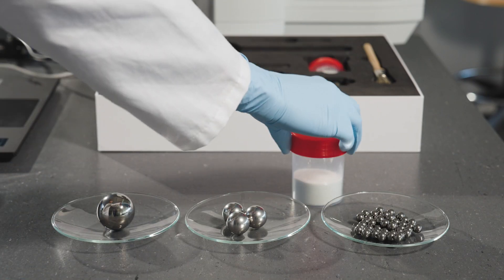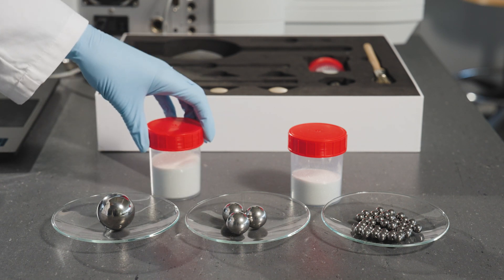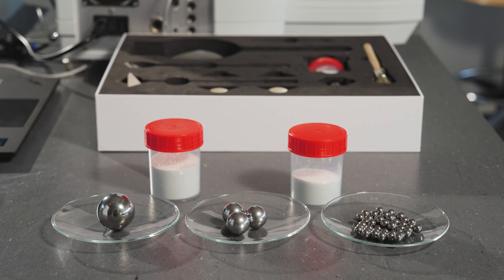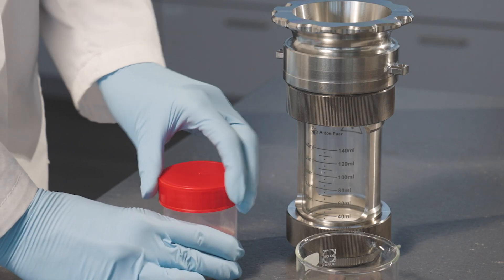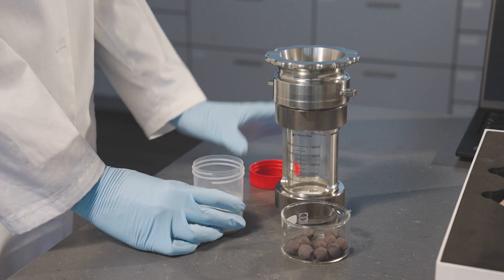The sample in question accounts for 25% of the total cell filling. Note that the minimum envelope powder quantity is 50 cubic centimeters for trouble-free operation. For example, enter 75 grams of envelope powder into the measuring cell.